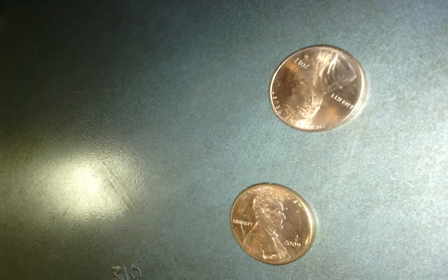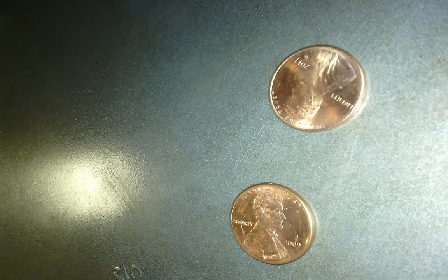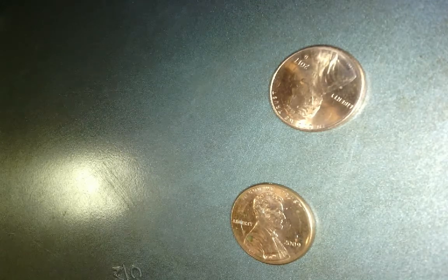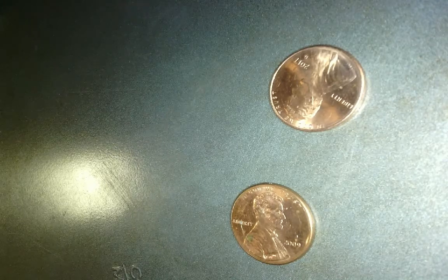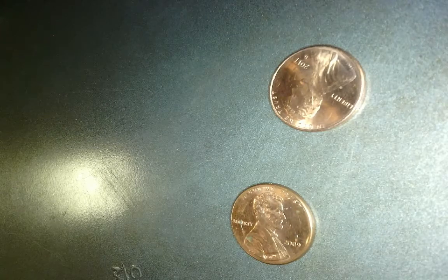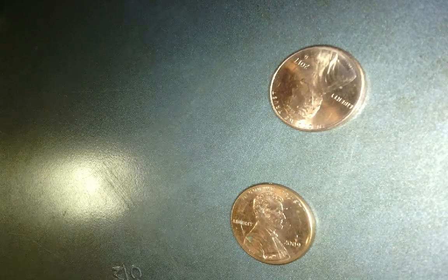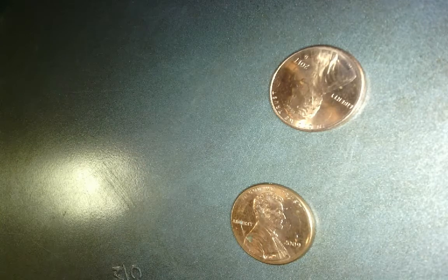In this lab, we're going to be going over intermolecular forces and how they affect certain properties. And the property that we're going to look at in this lab is surface tension. Surface tension is the ability for molecules to attract to each other, pull together, and lower the surface area that it covers. So let's see what happens between alcohol, isopropyl alcohol, and water.